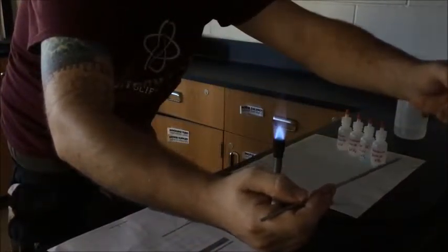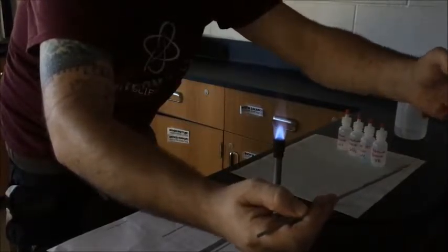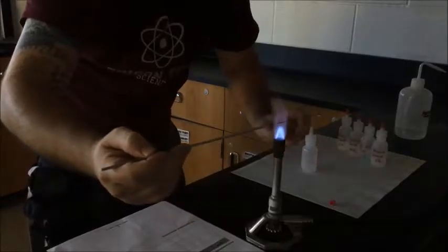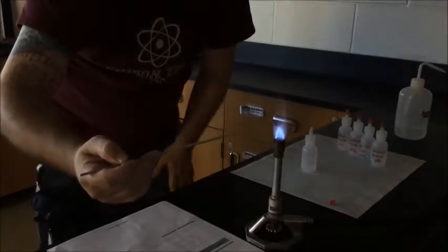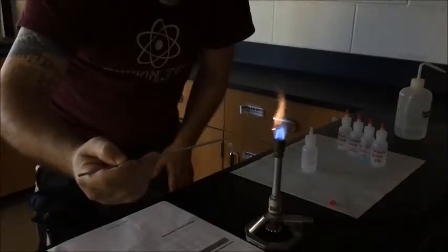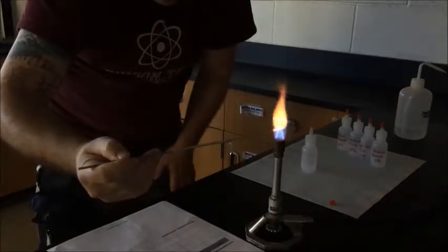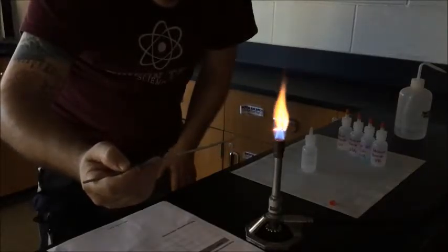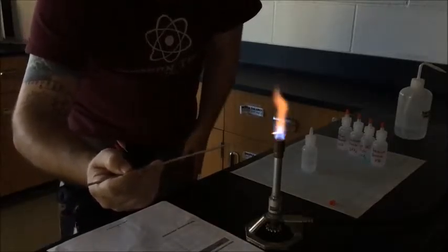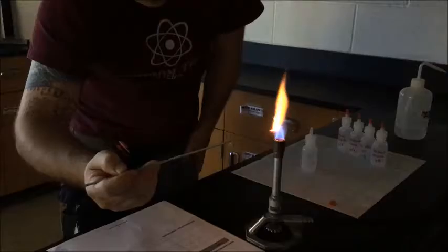Drop the chemical into the loop. Aha. Bigger drops usually get better results. Got to have a very steady hand for this. And then you hold it in the reducing flame and you see the dancing colors and those are the ones that we're looking for. Sometimes it dries up and you get a little residue. There we go. Yeah. So I would again record this as a light yellow almost green color for this particular chemical. Very important.